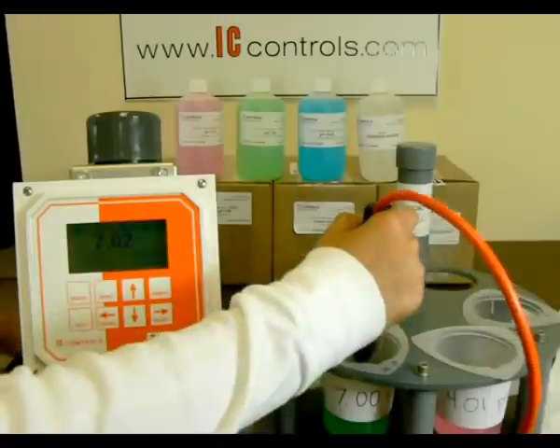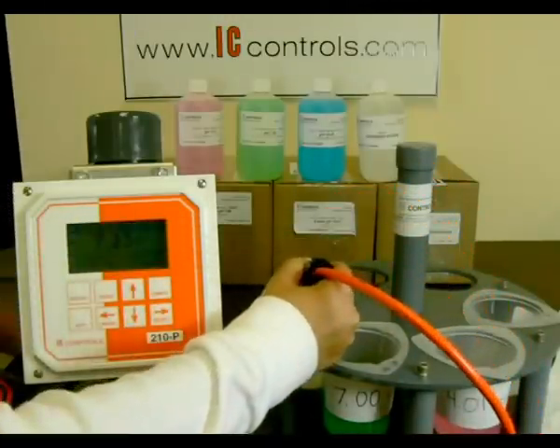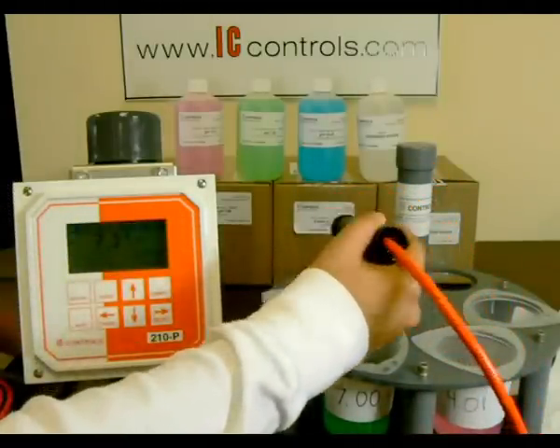Next, rinse the sensor and tap off excess water and proceed to insert the sensor in the red pH 4 buffer, stirring quickly.